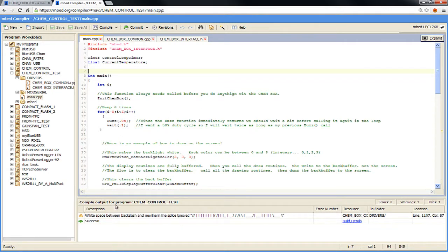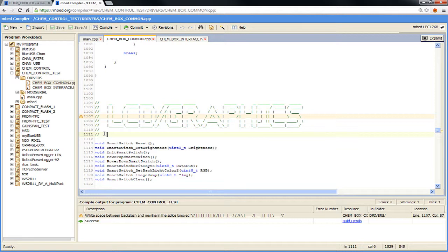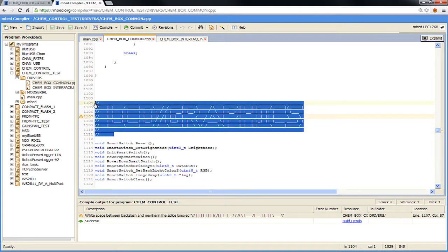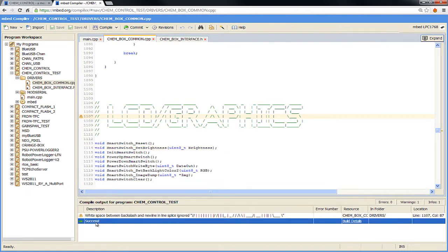And it gives me a little warning here. Don't worry about that. In some of my comments, I put these big ASCII art graphics. It has a warning, but that's not an error. It just doesn't like some of the white space characters in there. But the big deal is it says success.